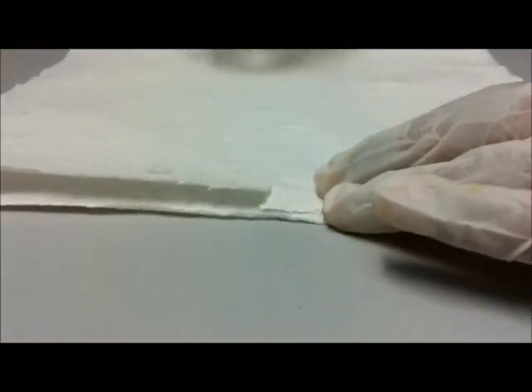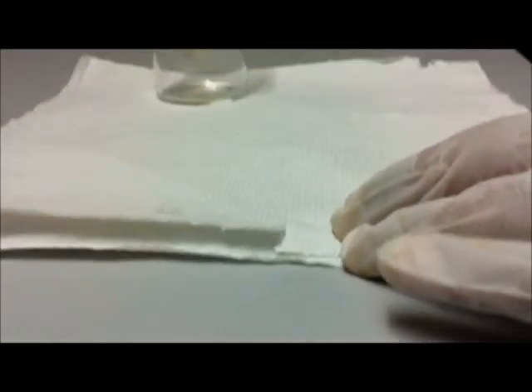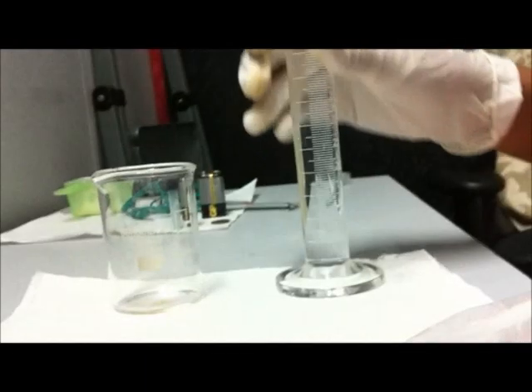For this you'll need a reaction vessel. In this case I'm using a 100 milliliter borosilicate glass beaker. Next you'll need some water. I'm using 50 milliliters of water.